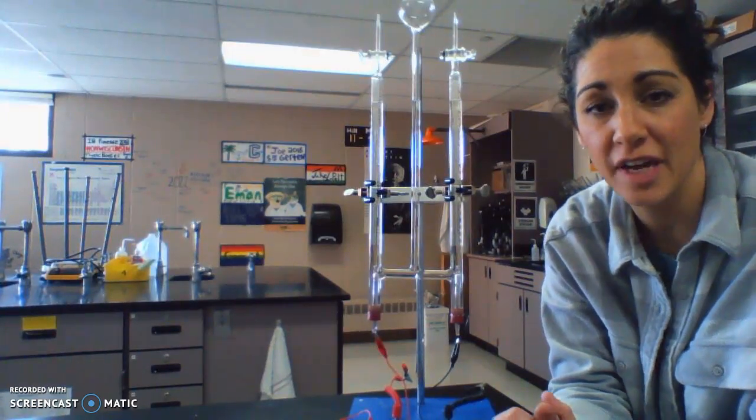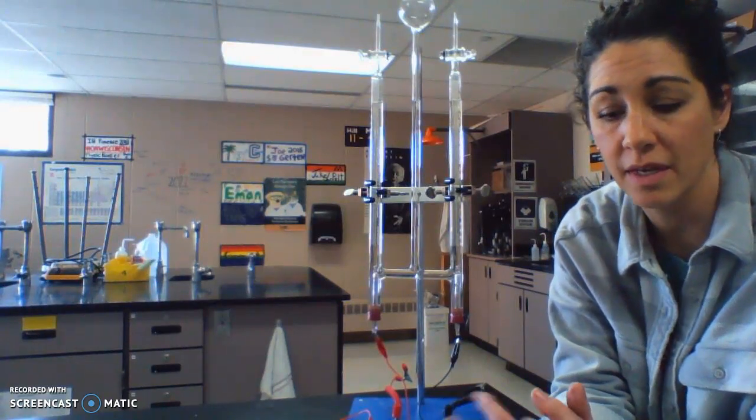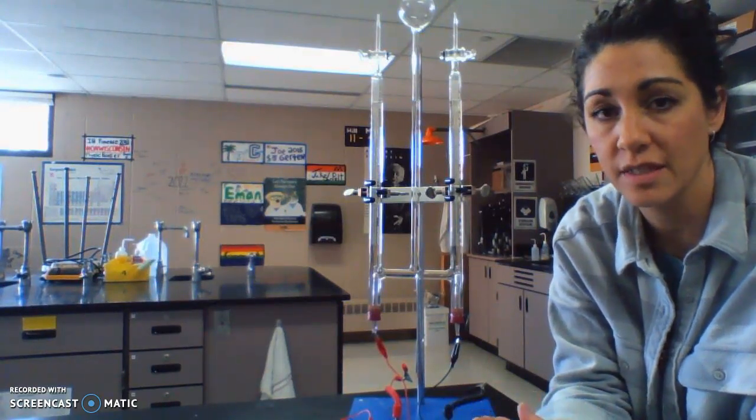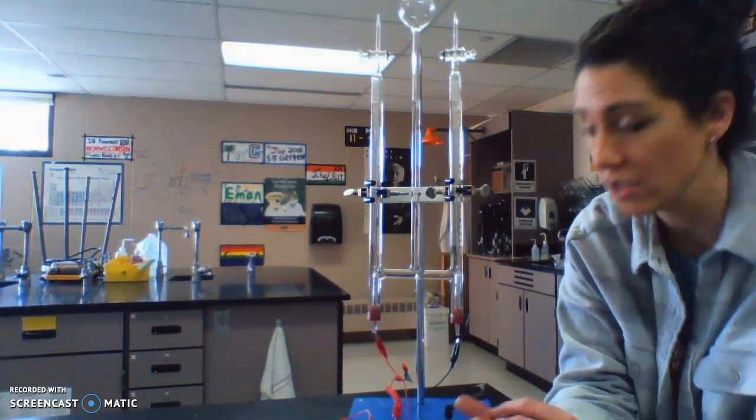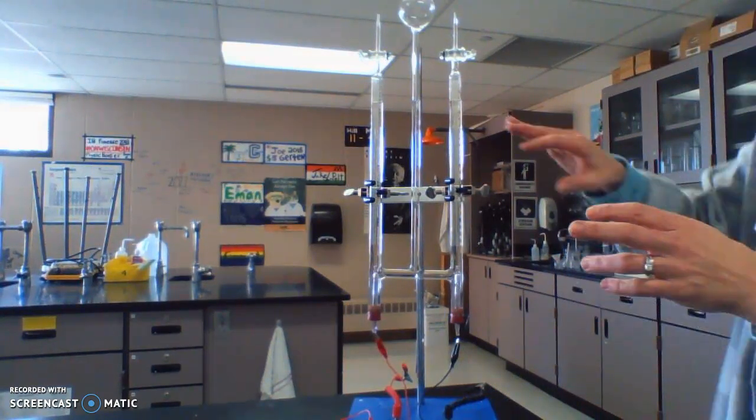Hi, I'm going to do the types of reactions lab, the two demonstration parts A and B. These were done as a demonstration in class, so I'm going to talk about part B first, the electrolysis of water.